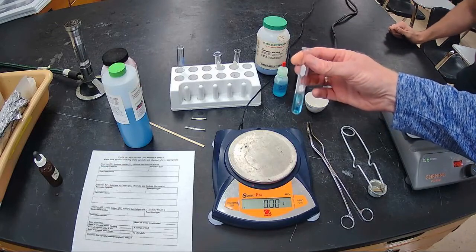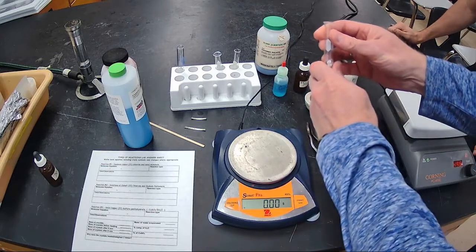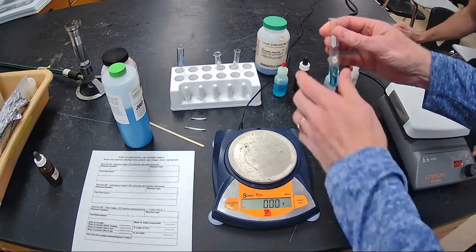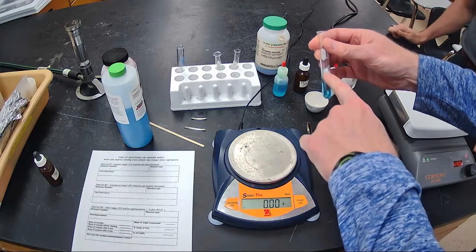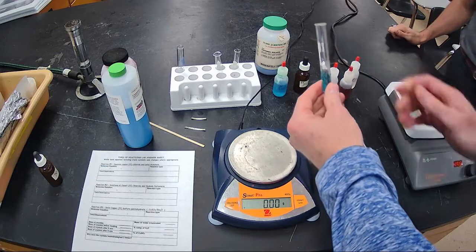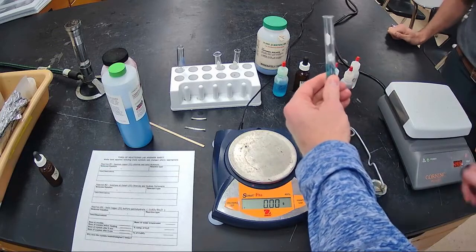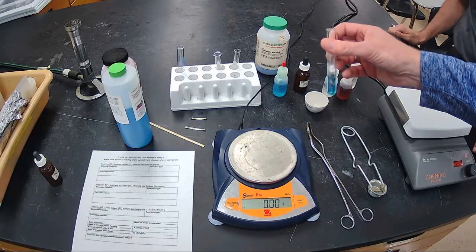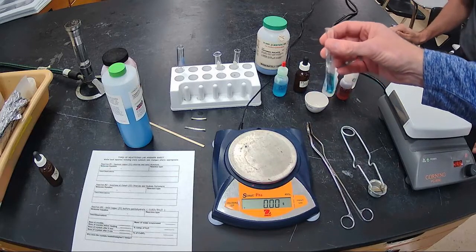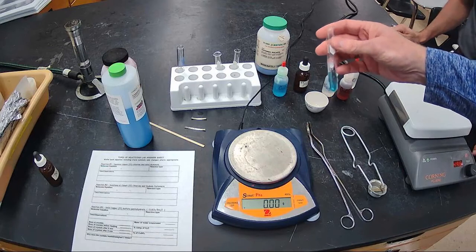So it's bubbling. It's a cold day out, so when you start to feel this, you can see some moisture and some steam on the inside of this. It's giving off some heat. Yeah, so you can imagine that if you see steam coming up, you definitely know that the water is heating up too, and that's leading to some exothermic reaction, energy release.